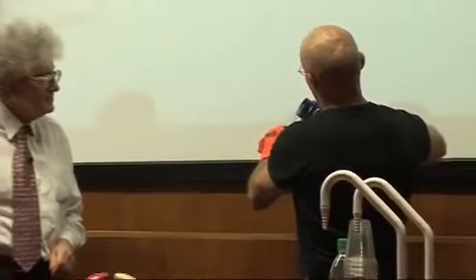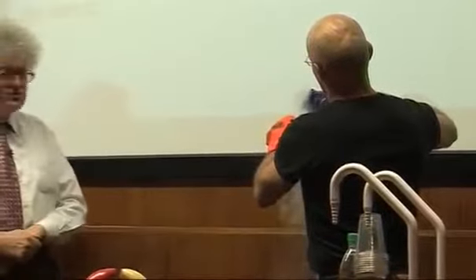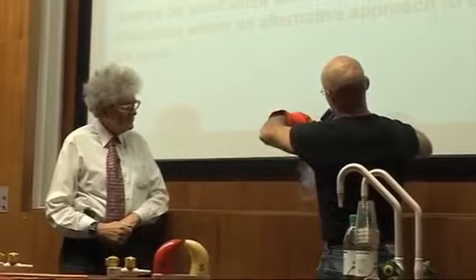So we begin with Neil's very high-tech piece of equipment, which is a test tube on a piece of string. What we're going to do is to put some liquid nitrogen in here. You can see liquid nitrogen, well, you may not see, is colourless. Okay?